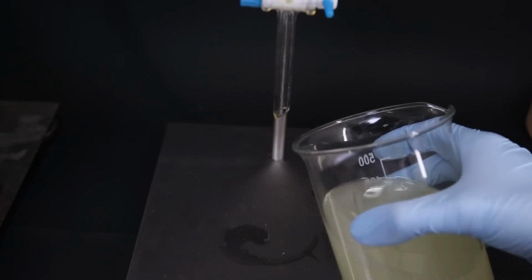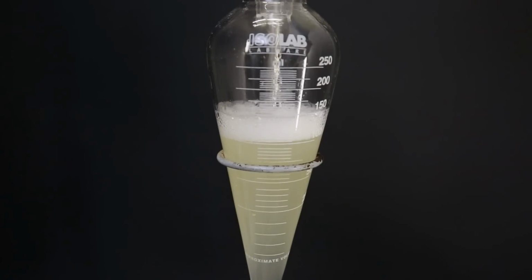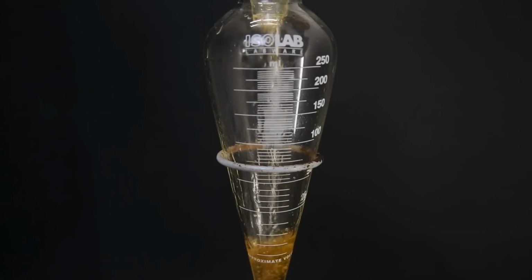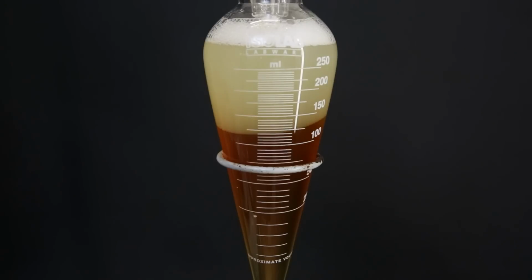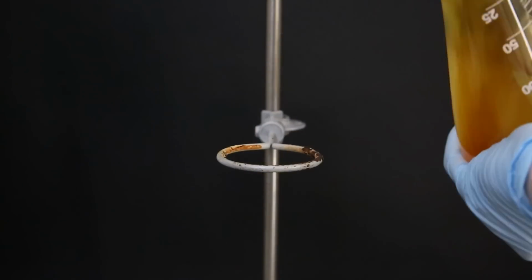Now what I have to do is extract the aqueous layer, which I will do with some DCM. But this is the part where I somehow managed to mess up. I poured the organic layer into the separatory funnel and added the DCM, which both just mixed and didn't really do anything. So since I didn't have all that much DCM, I didn't want to use too much of it. Since the organic layer is now diluted with DCM, I just poured the organic layer with the aqueous layer and hoped that the DCM would still pull out product that was left behind in the aqueous layer. So anyway, I get to shaking and I do this extraction a few more times and separate the layers.